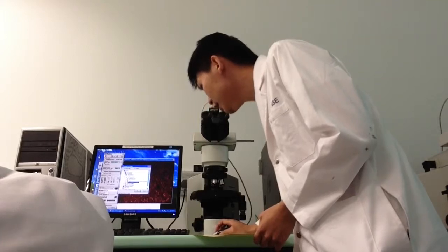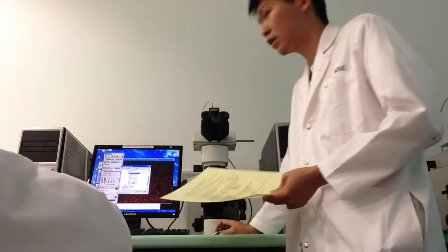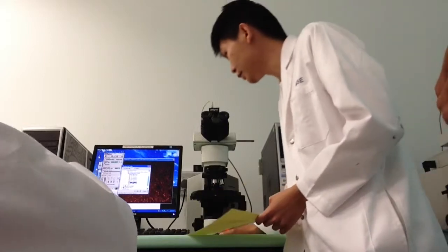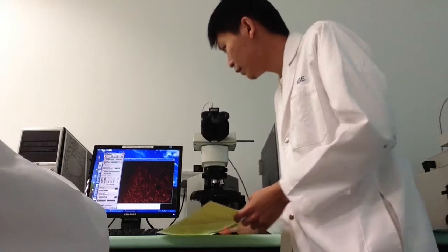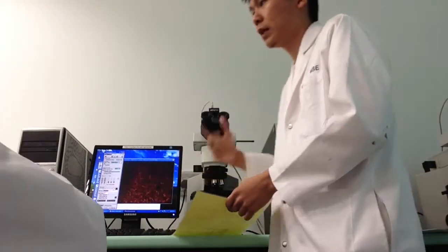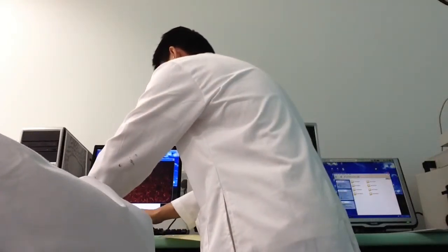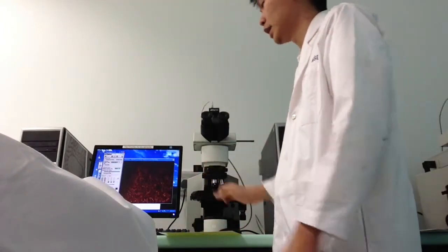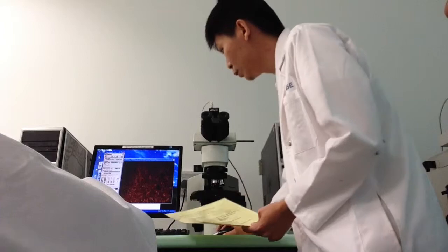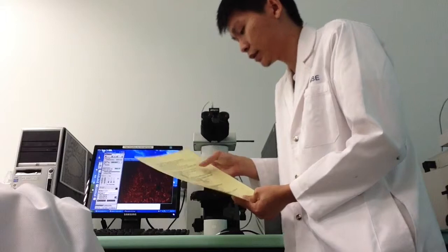You should see the file path, this MS2082 PB5. And choose this one, GB7. You got that right? And for the file name, you have to type in, for this sample it is copper. So choose copper and 5 times, because you'll be using the 5 times magnification. After you input your file name, you click this grab frame, which is number 6.